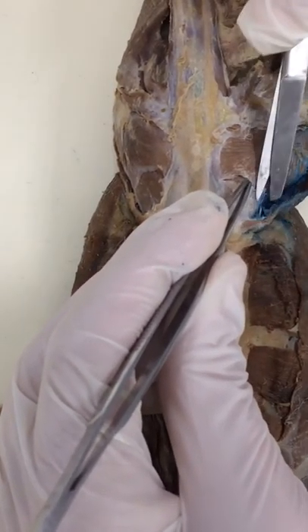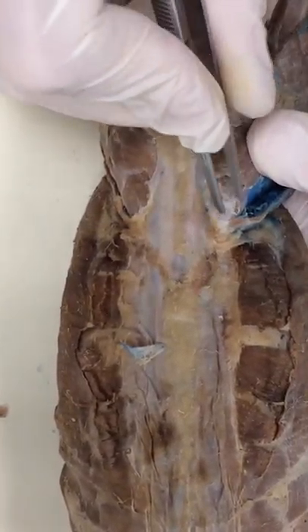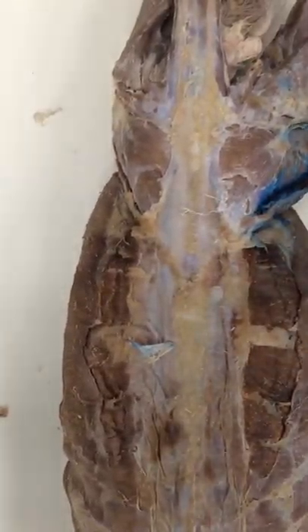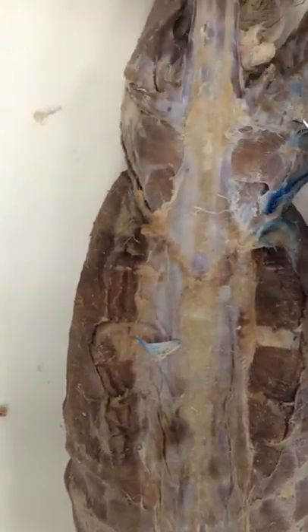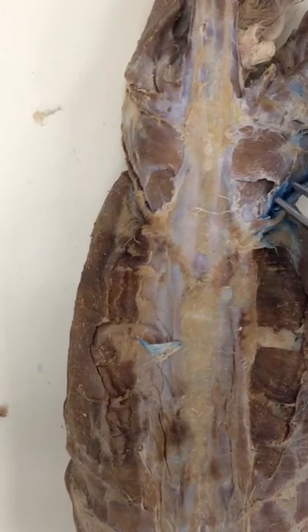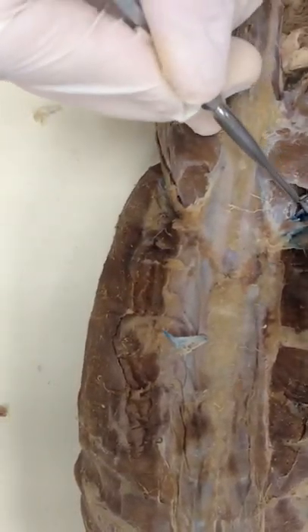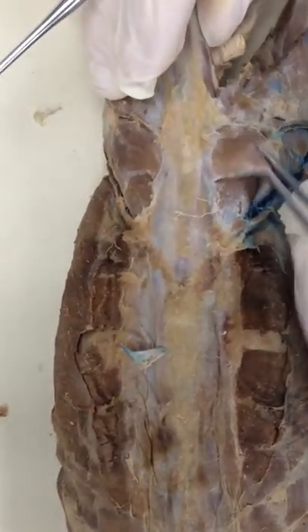Missed it a little bit. There we go. I'm just going to take this piece of tendon and peel this off — you can see I'm just peeling that off. I'm going to take maximus with the round side of my probe. I can see I missed a little bit of that tendon, so I'm going to free that up some more. I'm just going to take my probe and run it under maximus like this, just clear it off, go around the bend, follow the shape of medius. Here's maximus freed up.